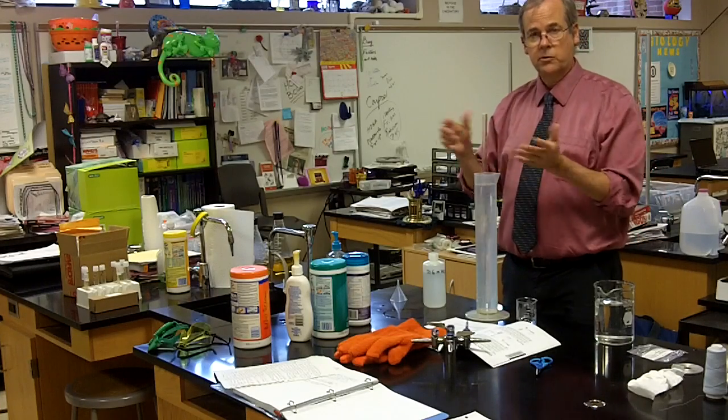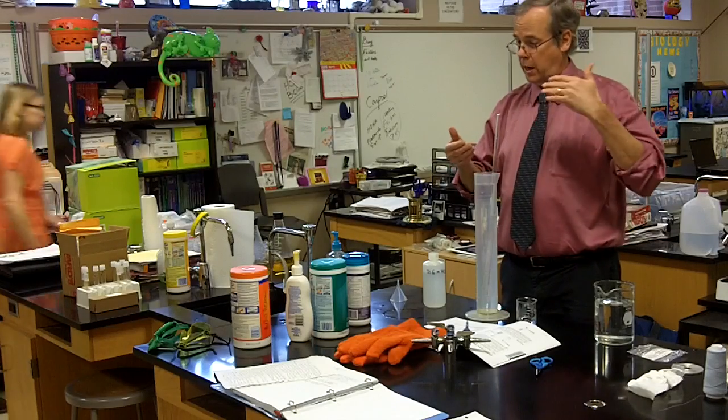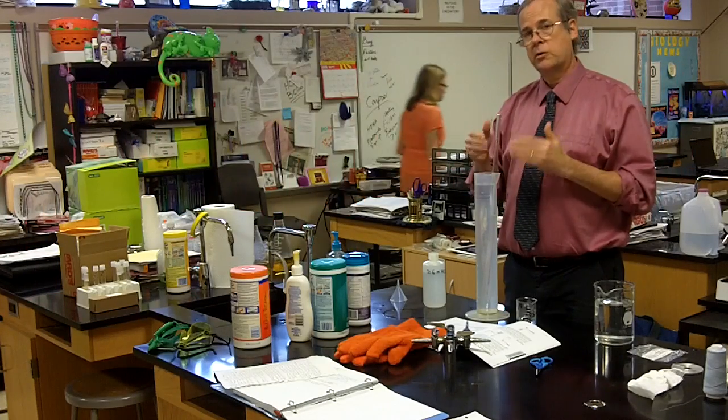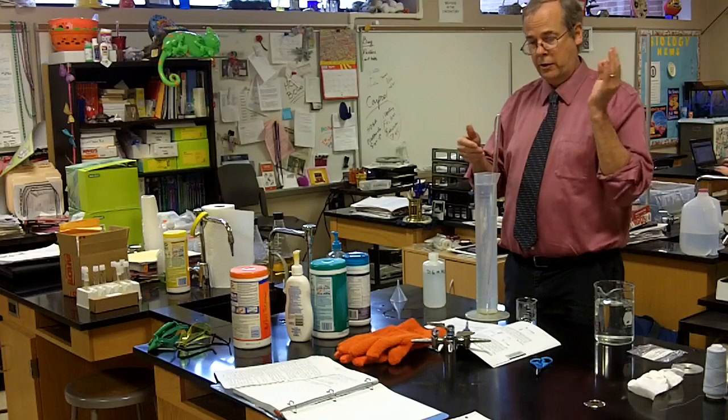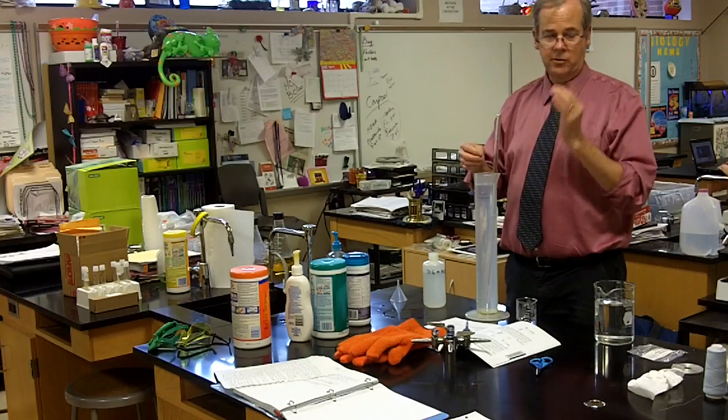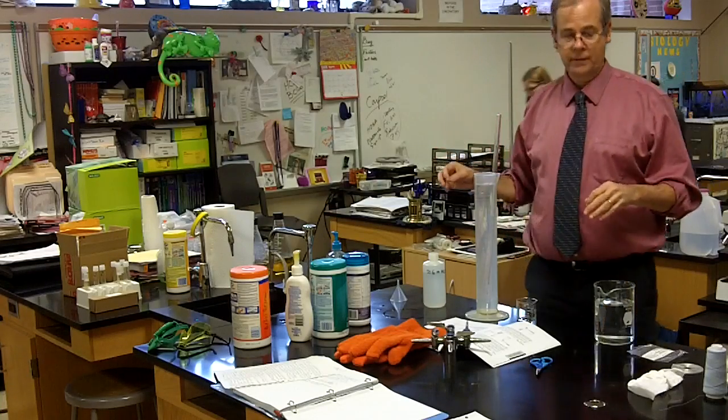Then all I have to do is some calculating. I will take my pressure. I'll eliminate the portion of the pressure that's water vapor. It's Dalton's law. There are two gases in here. And I'll know the pressure of the hydrogen gas alone. I'll know the volume. I'll know the temperature. I can calculate moles.